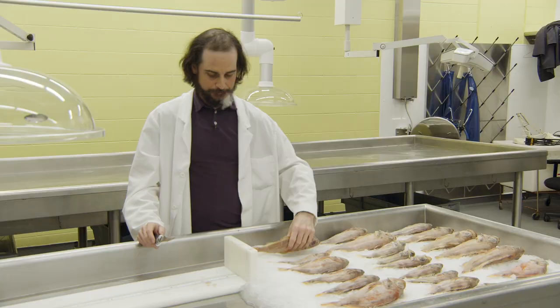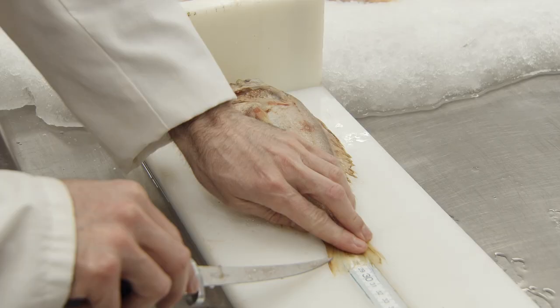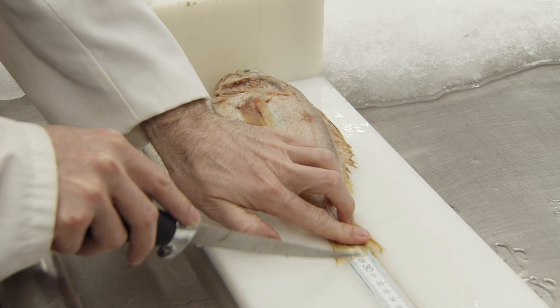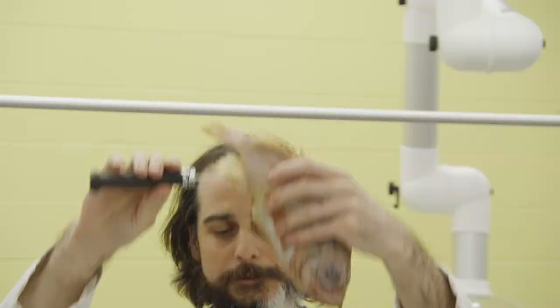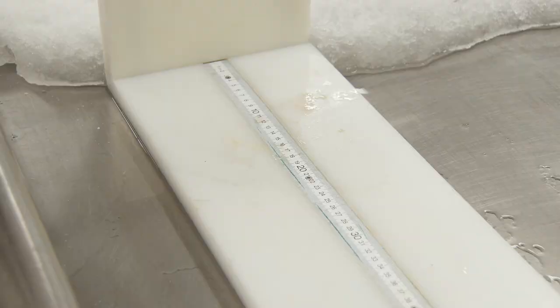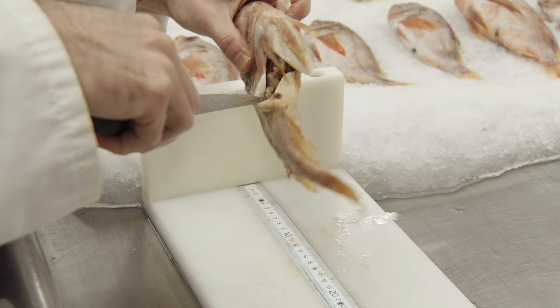Second fish — still make sure that the mouth is closed and touching the board. Fork length for this one is 29 centimeters. We will then count the number of anal fin rays: one, two, three, four, five, six, seven, eight. And then we will sex internally. In this case, we have a female.